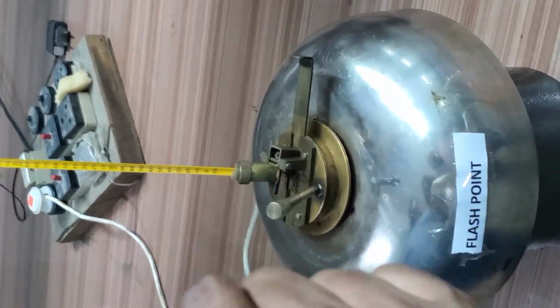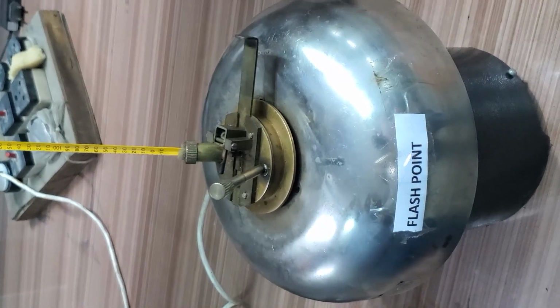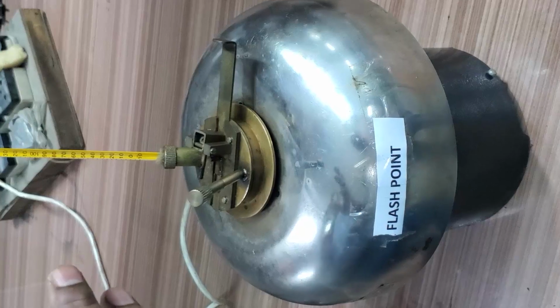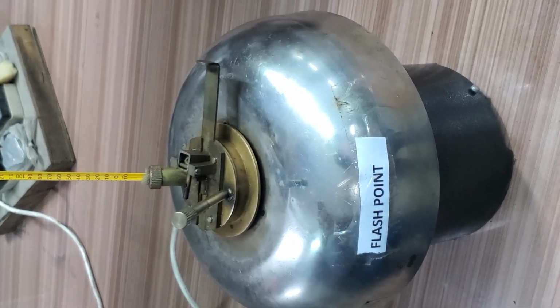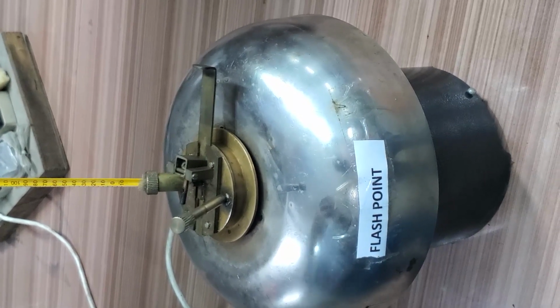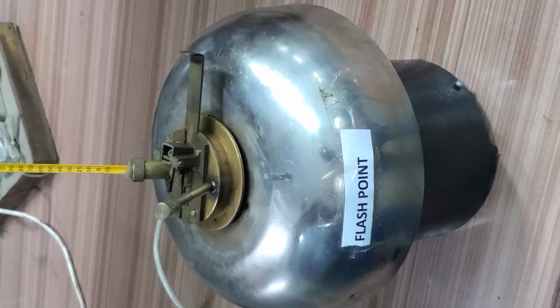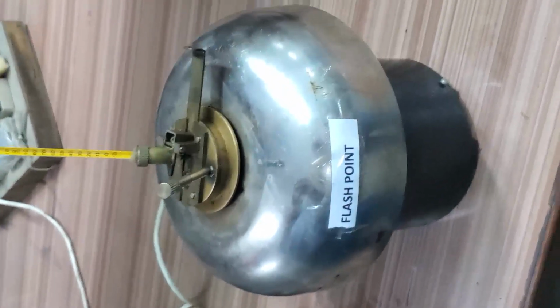So this flash point is also very important. This is the measure of fire risk. Suppose you want to store this oil as fuel storage, or you want to transport the oil in a tank. So this flash point is very important. If you know the flash point, then we know that we can safely transport the oil, or safely store the oil. Suppose our flash point came at 75 degrees for the given oil. If you are getting a flash point of more than 65 degrees centigrade, then those are safe oils.